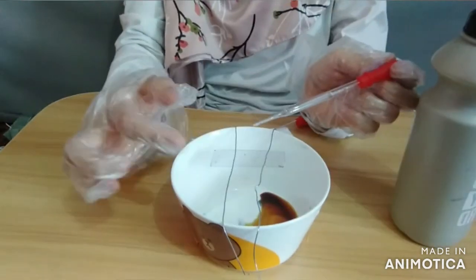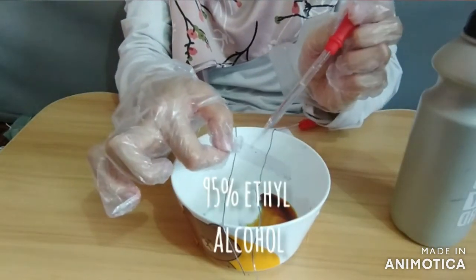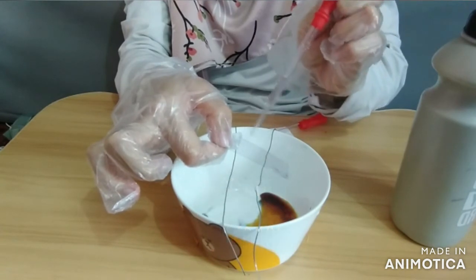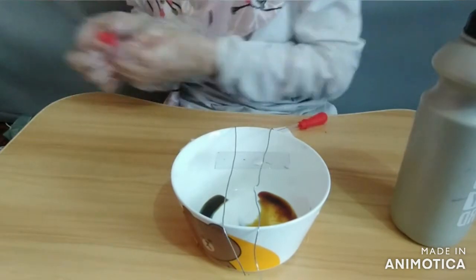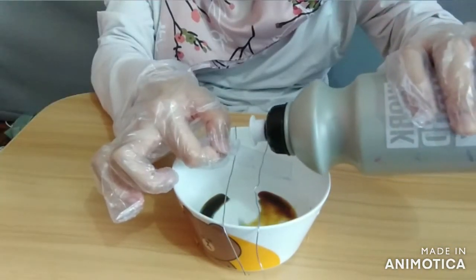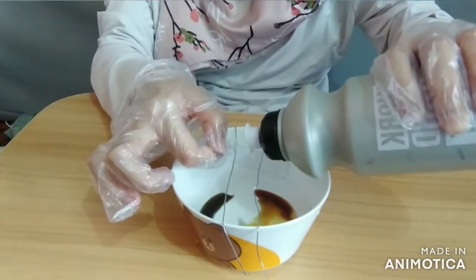Then decolorize the smears with 95% ethyl alcohol until the alcohol runs almost clear and leaves only a blue tinge on the smears, and then gently wash it off with tap water.